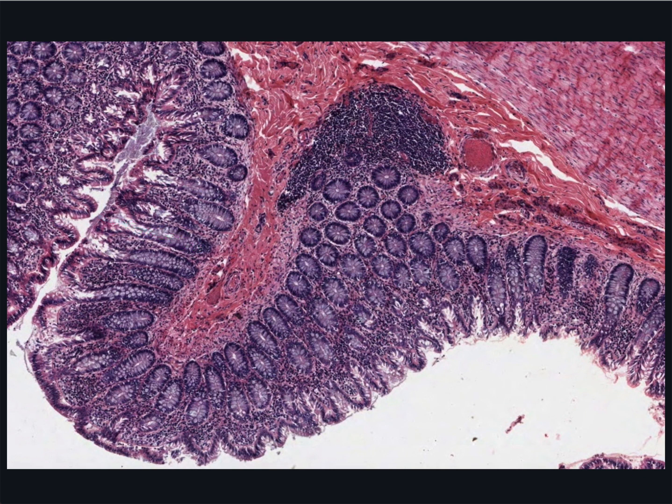What is our main focus here are the many lymphocytes present here in the lamina propria, characterised by their small dark nuclei. They're all on surveillance duty, seeking out antigens they have been trained to recognise. Having recognised an antigen, lymphocytes then travel to lymph nodes nearby and proliferate and differentiate before returning to the lamina propria as effector B and T lymphocytes.